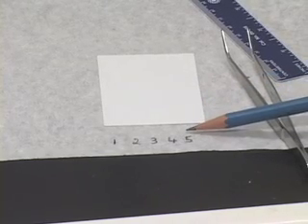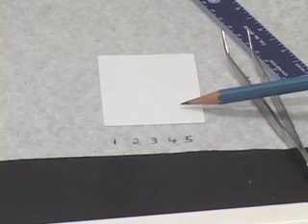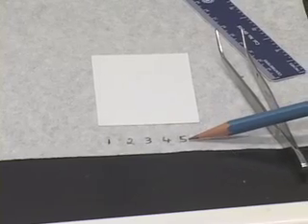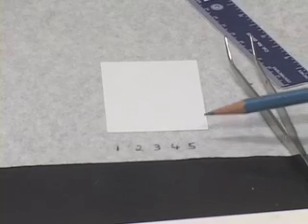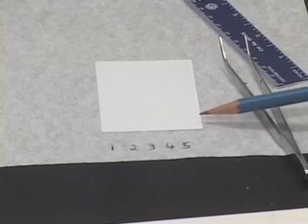On the spot that I have labeled 5, I would like to apply my unknown. So, take your unknown and touch the capillary twice where it is labeled 5. Notice that these labelings are not marked on the plate. We do not want to etch away the silica coating on the plate.